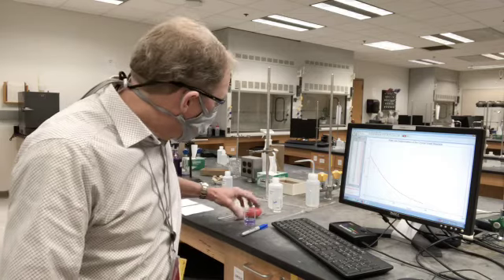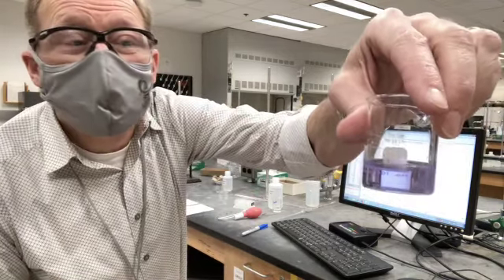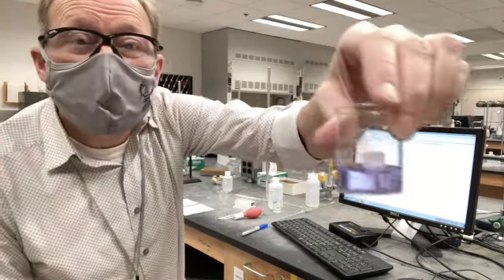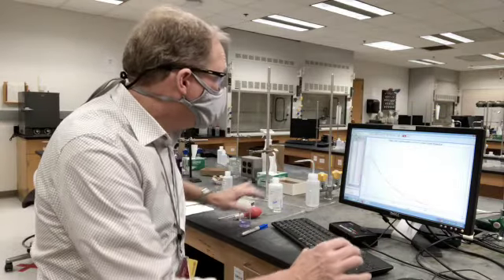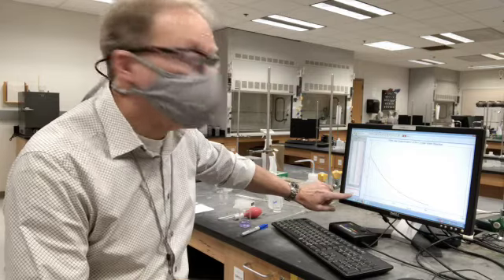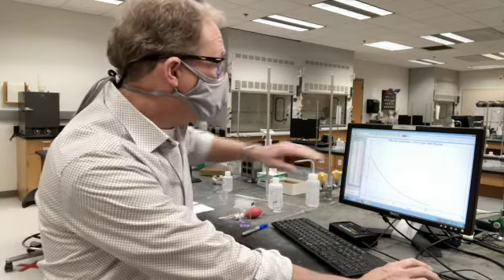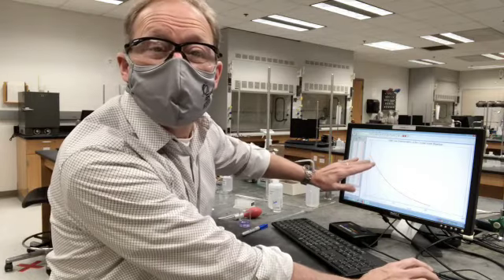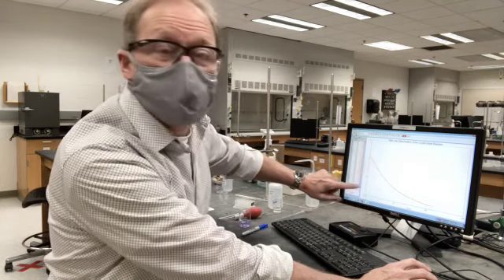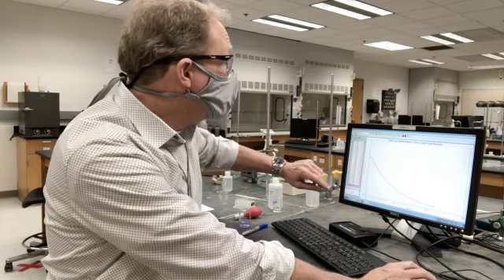The color in my beaker — the crystal violet — has not completely gone but it's pretty faint now. The absorbance here in my curve has faded to less than 0.1, and that's good enough. We've discovered in the analysis that analyzing this data between absorbance of 0.7 and 0.2 is good. I just let this go a little bit beyond all the way to below 0.1, and I can click stop.